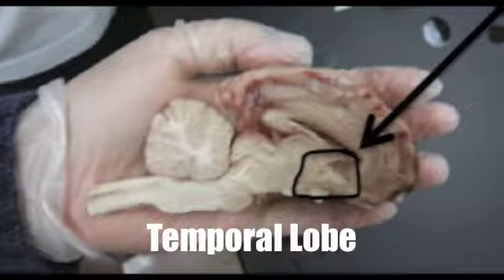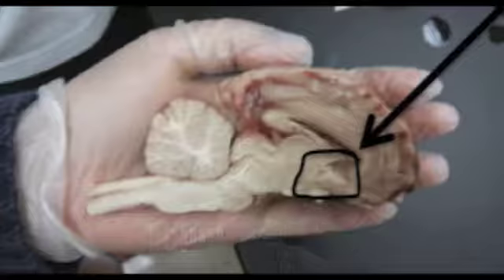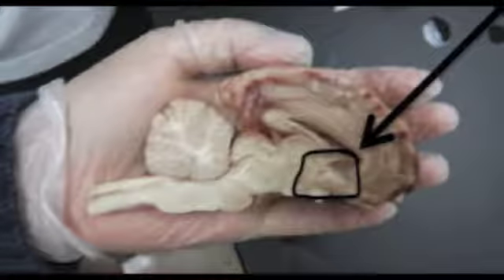The temporal lobe contains the hippocampus and controls the formation of explicit long-term memory modulated by the amygdala. The temporal lobe is also responsible for auditory senses, visual senses, language recognition, and new memories.